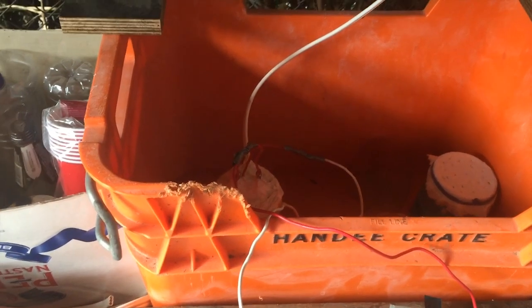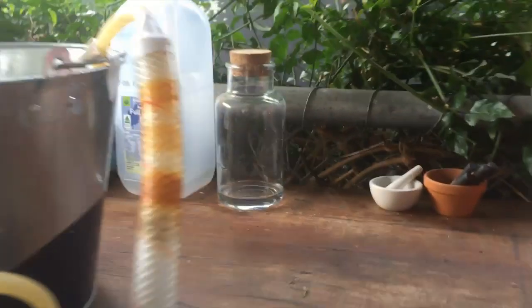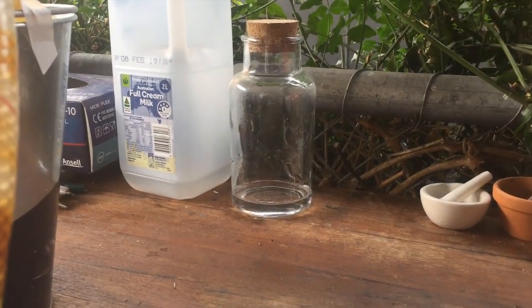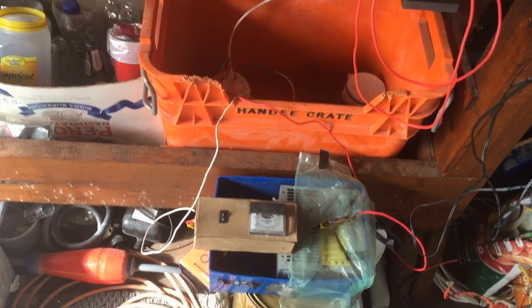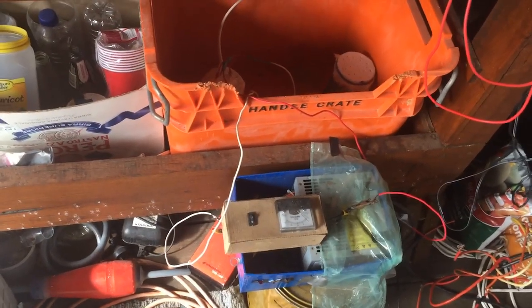Hopefully in a week or so this will be reduced to 200 millilitres, and then we'll do the same for all the water that we've got over here. So I'll see you in maybe a couple of weeks' time when that is all electrolyzed down.